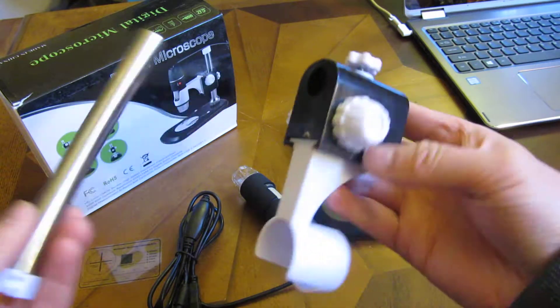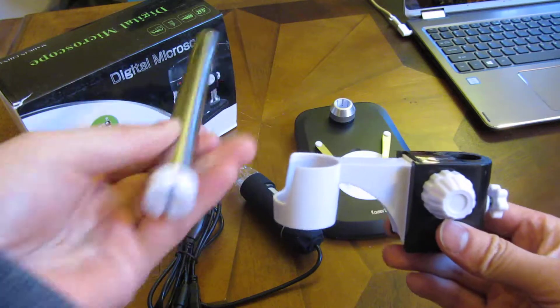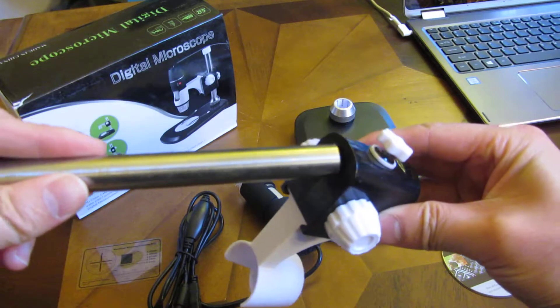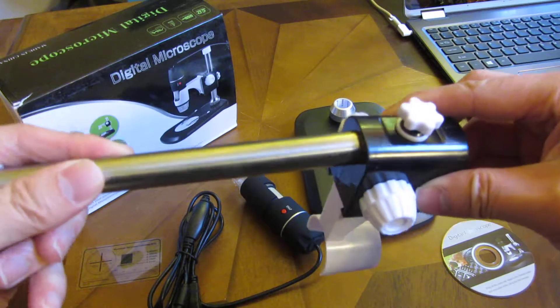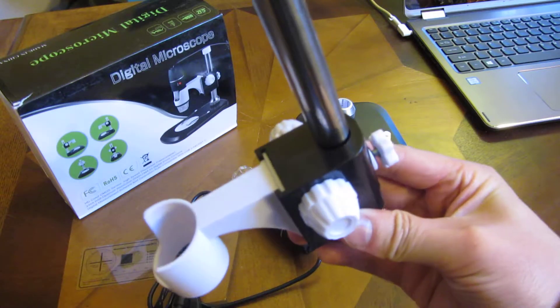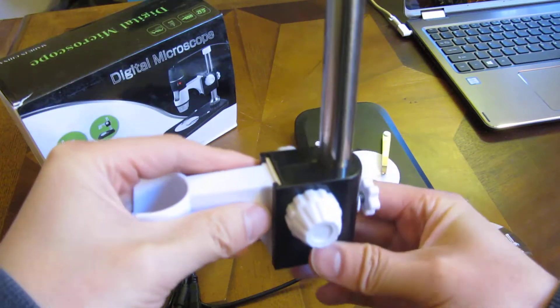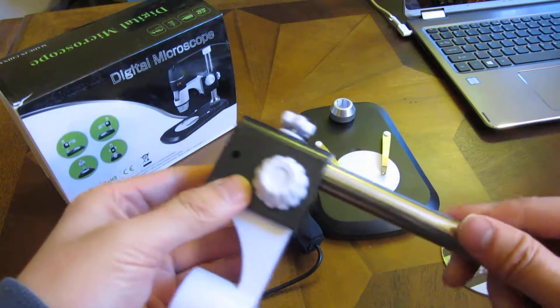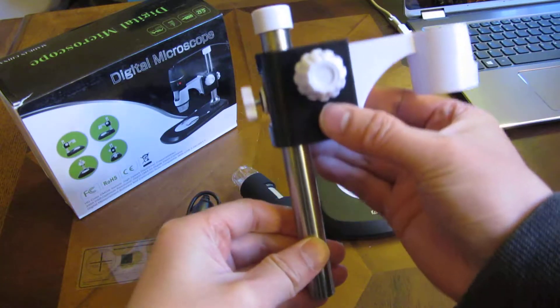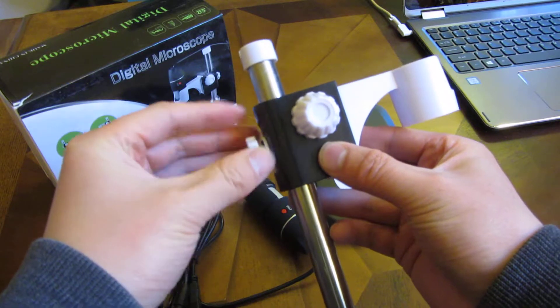As you can see, there are a couple of knobs. Make sure to loosen this knob such that this tube can fit in. I'm going to fit in the tube here — this tube will actually control the vertical axis. As you can see, I can slip it in now, and you can control the vertical axis and tighten it using this knob.